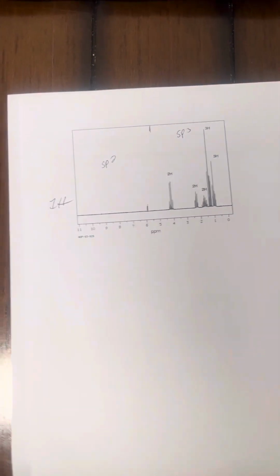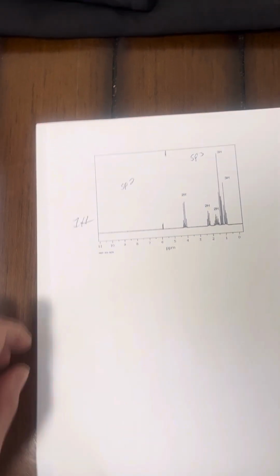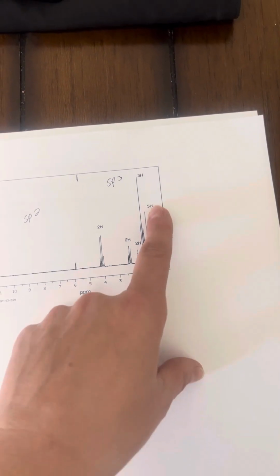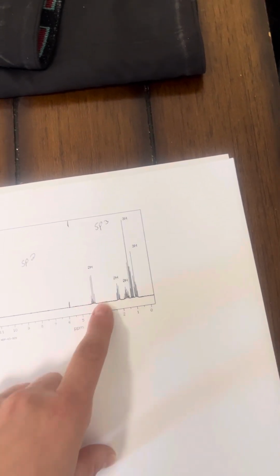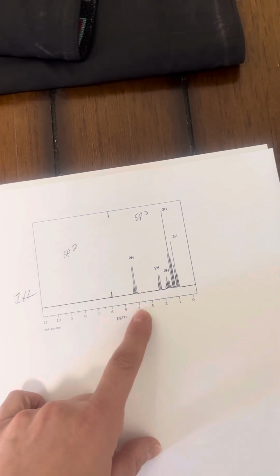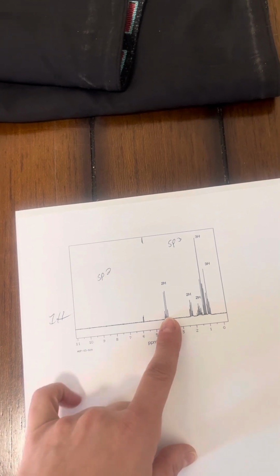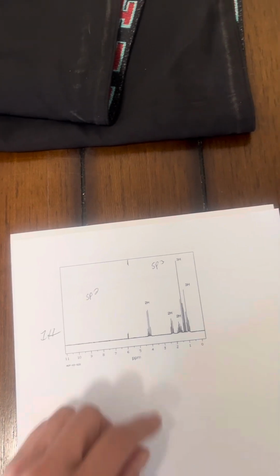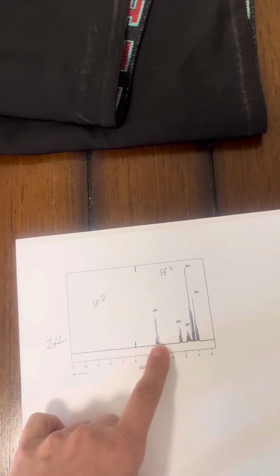And then for our final portion of our analysis, we're going to use our chemical shift to determine how the molecule is put together. Actually, let me start on the other side. As you can see, we have 2 hydrogens here, right about 4.2, 4 lines, which makes it a quartet. That would be an oxygen bonded to a CH2 and a CH3. I will show you my documentation momentarily.